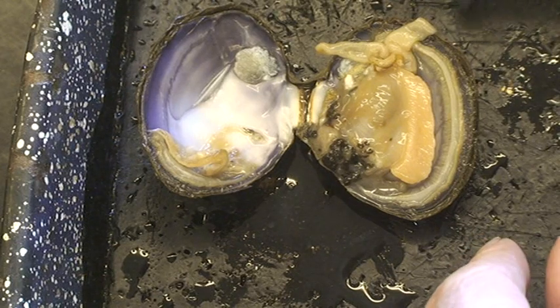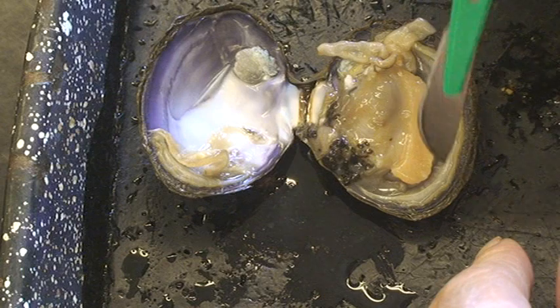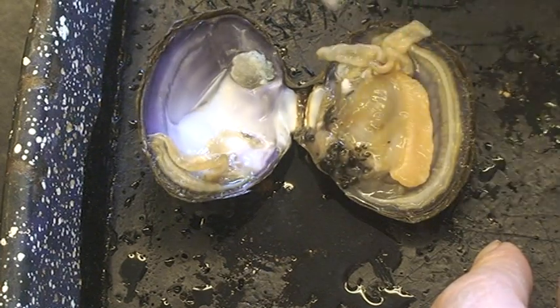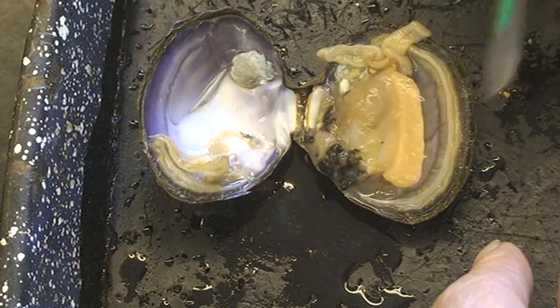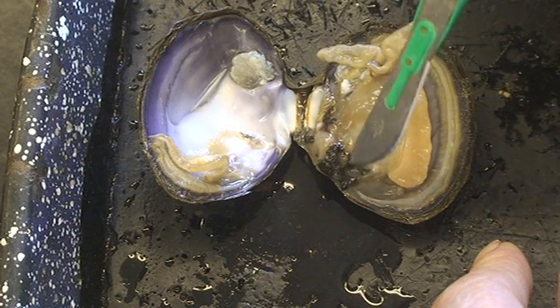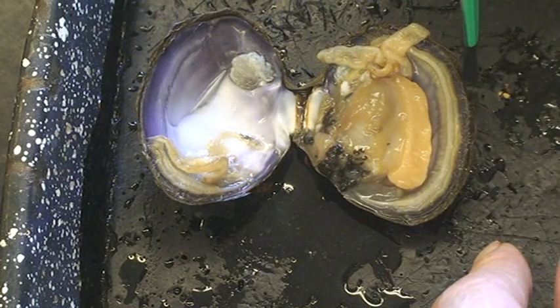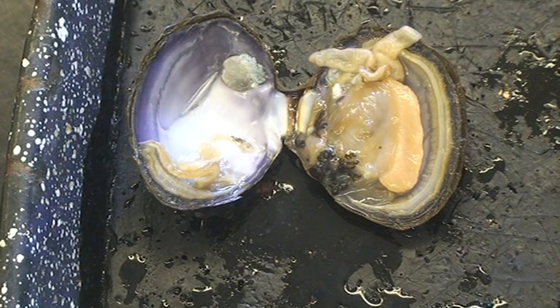The important things are: no segmentation; a mantle, which only mollusks have; large gills inside the mantle cavity; and these have a large foot — other types of mollusks don't have such a large foot, but these do. The other mollusks have a different way of feeding. Only the clams have a crystalline style like that. Most of them have a radula instead, and when we talk about mollusks we'll talk about the radula later. But these don't have them. With that, I'll close this video.